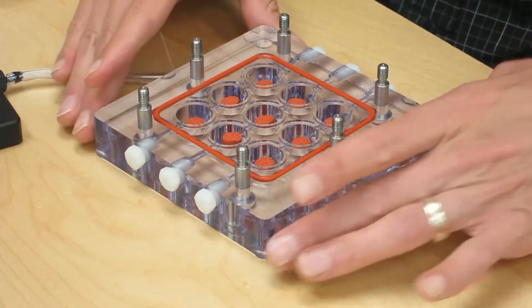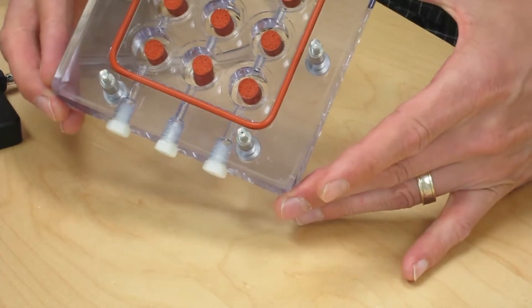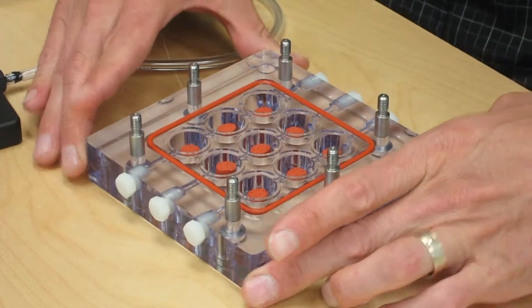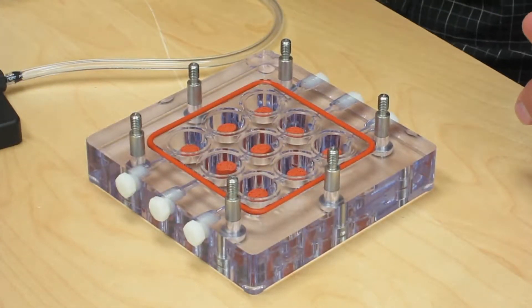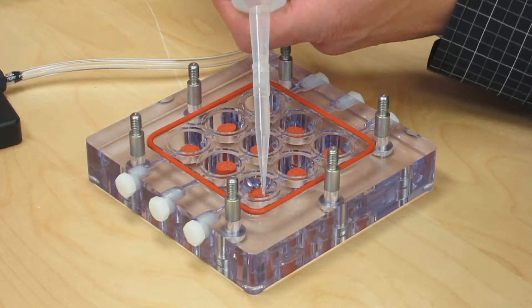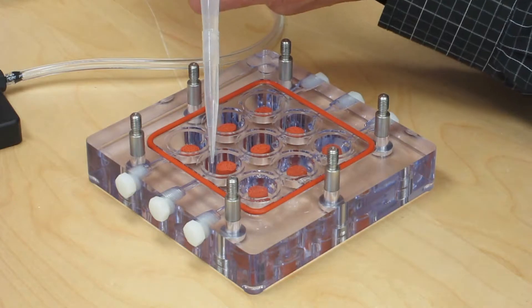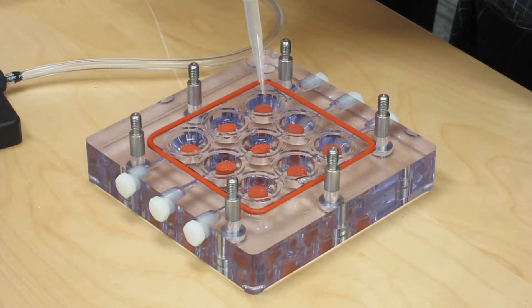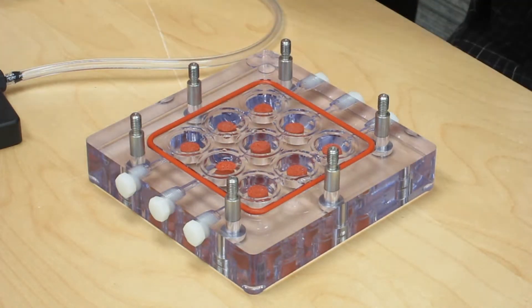There, I've got the last two in there. There's all nine of the specimens sitting in there. And the next thing I do is fill up the wells with fluid. There, that looks pretty good.